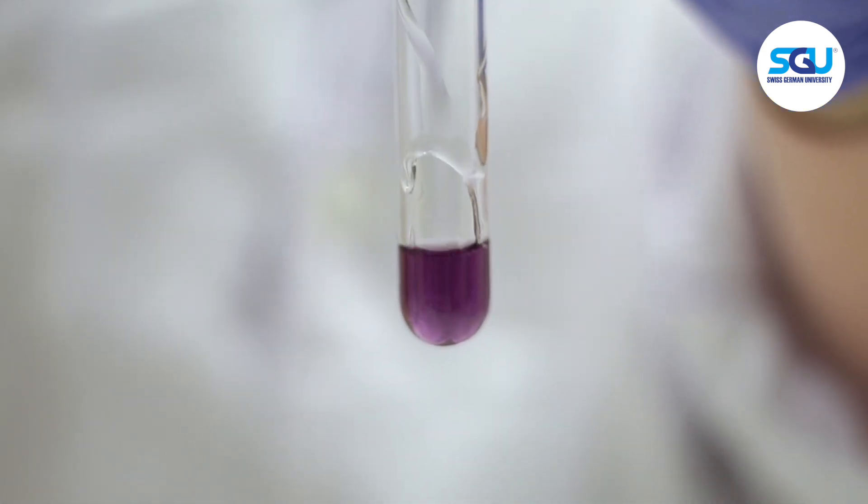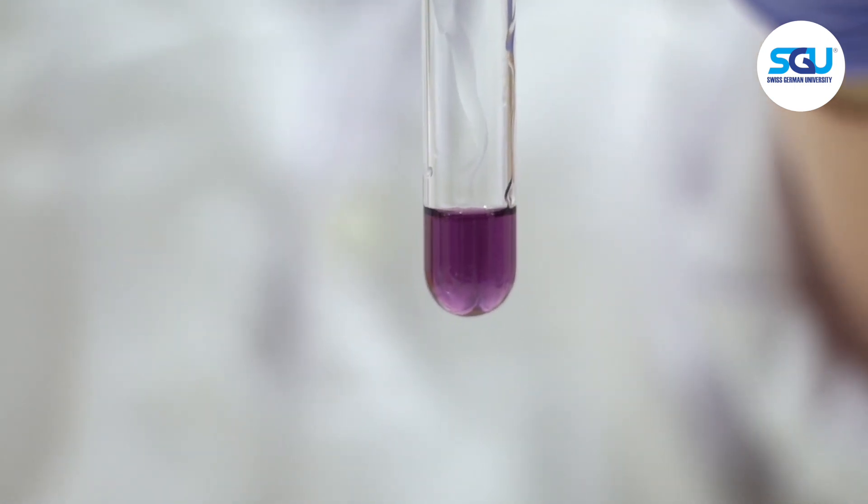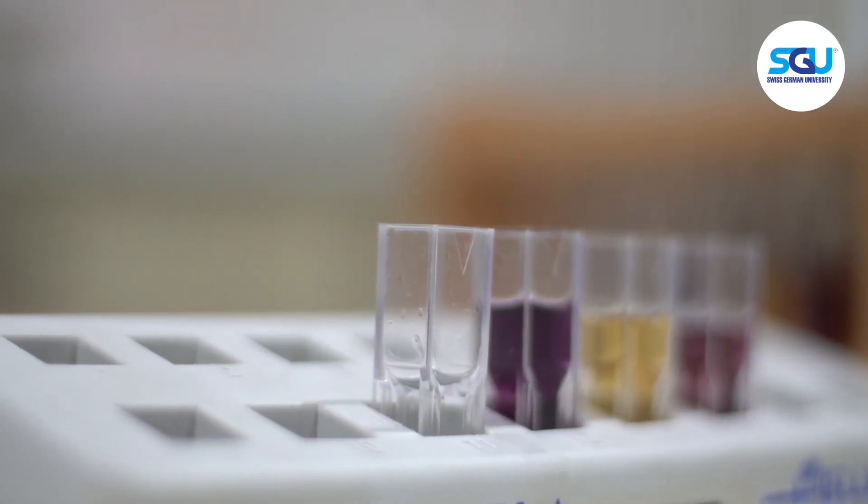The third cuvette is a control sample, which contained only DPPH solution. And the fourth cuvette is a blank sample, which only contained methanol.